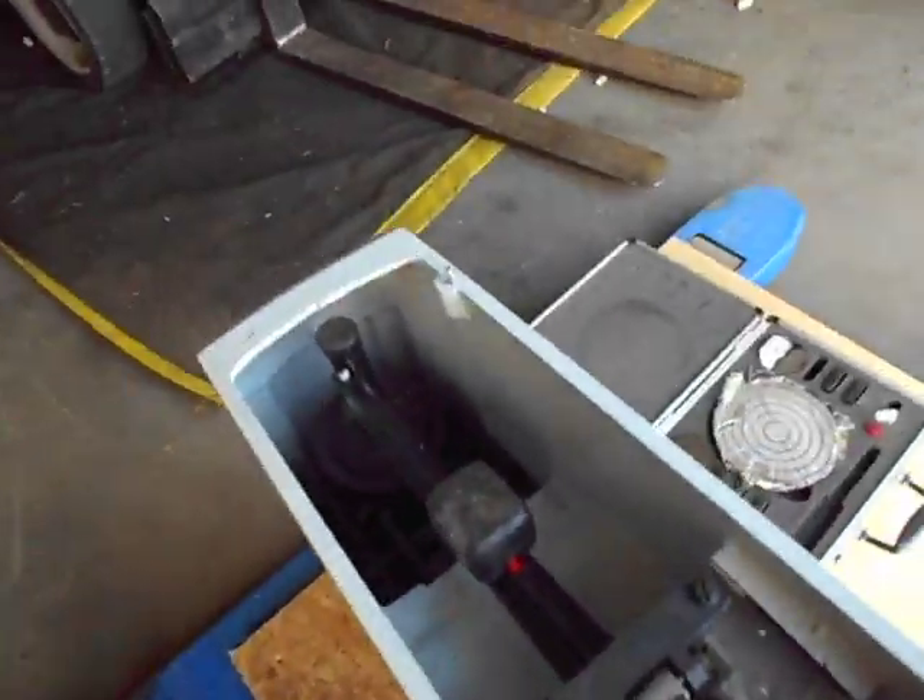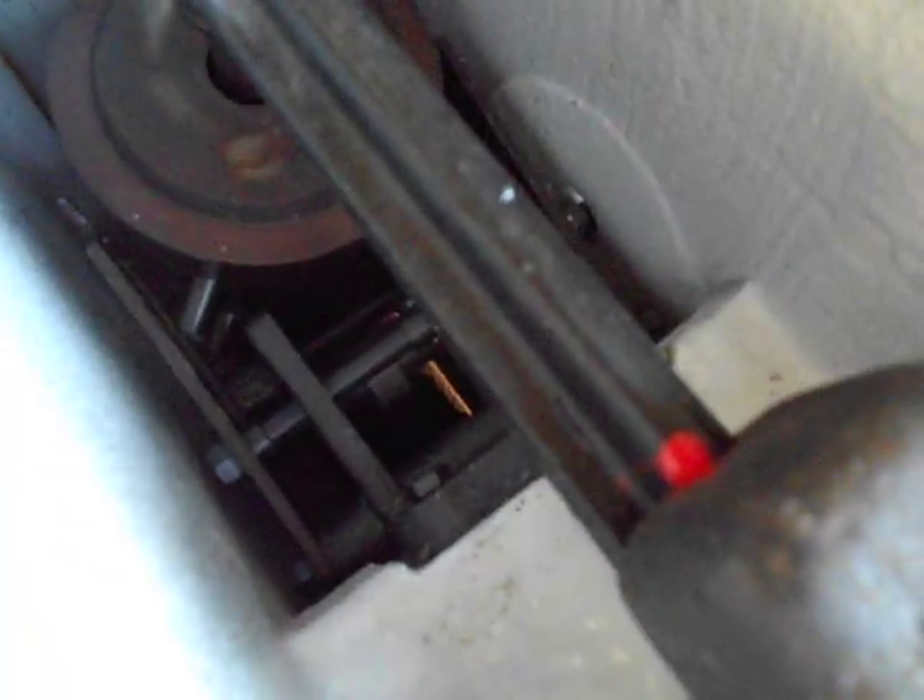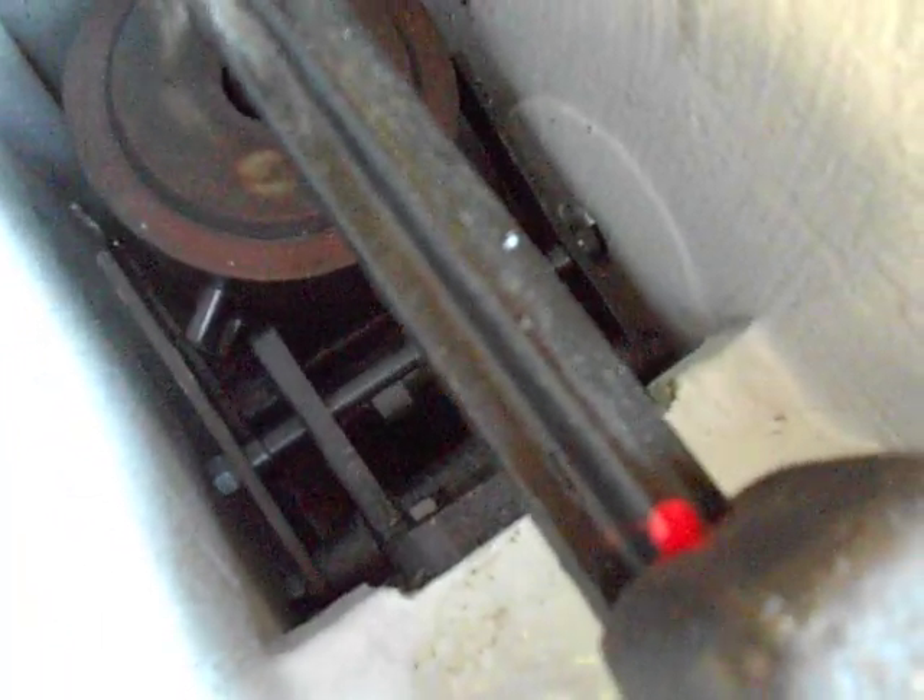Open up the top compartment here. You can see that it actuates when the dial is turned. I got it set back, and you'll see the little plunger move ever so slightly. Here goes the handle — put it back.